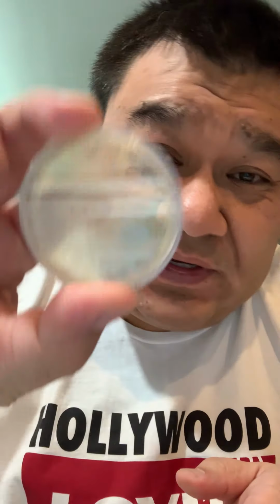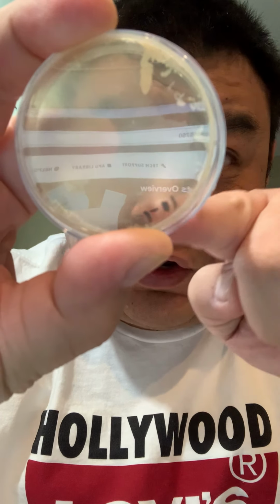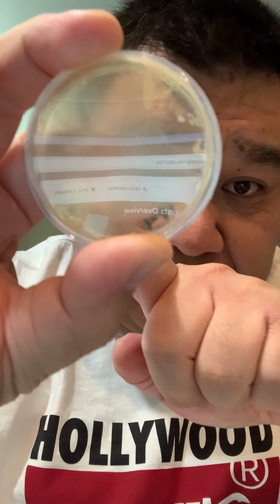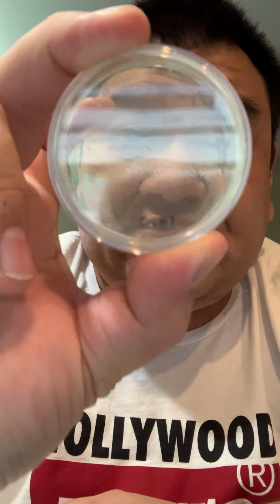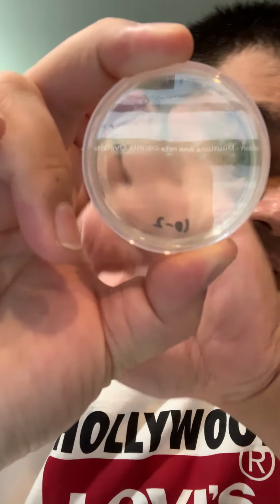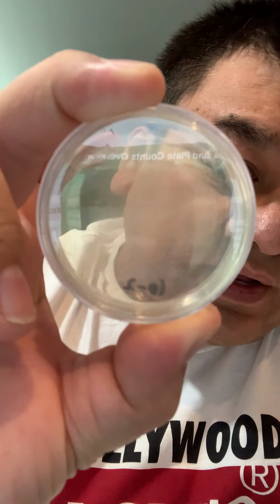As I noticed on my 10-1, I had clumps, big clumps, and then it became micro thin dots. Not so sure if you can see it because of the reflection, but I had a lot of clumps right there and around the corners, and then a lot of little dots in the middle towards the outside. My 10-2 was just tiny dots everywhere. Sorry for the reflection. 10-2 had little dots everywhere.